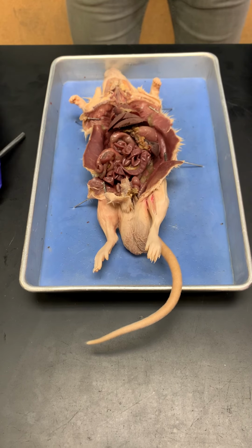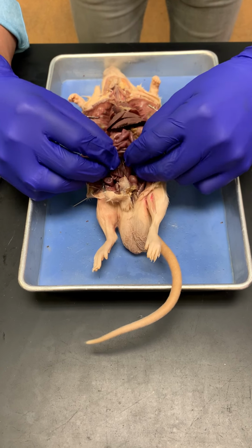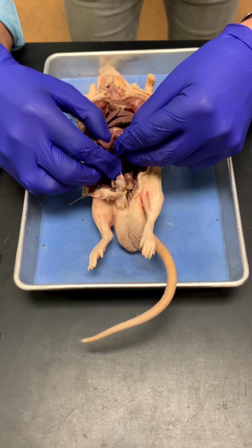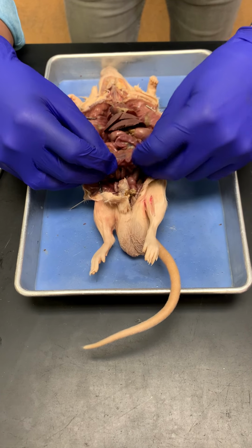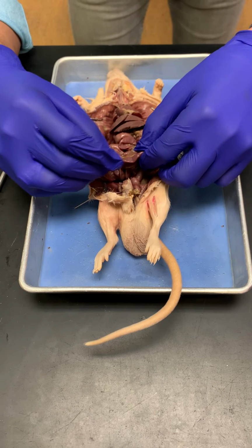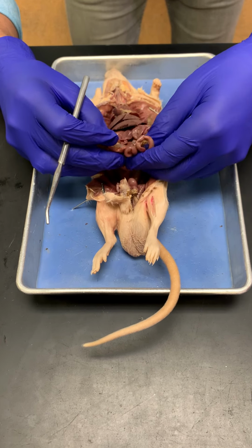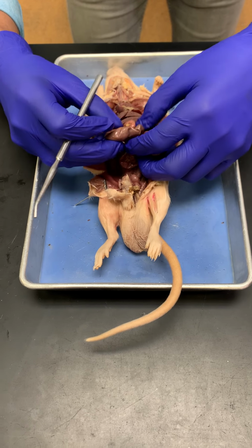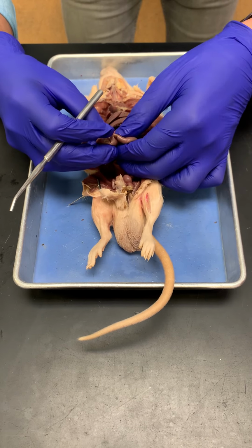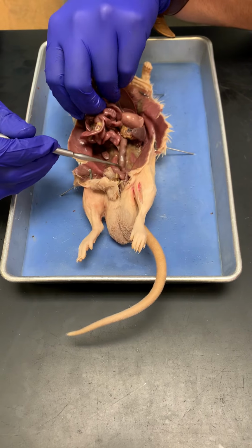And then the small intestines include all of this stuff. And all of this stuff right here, that keeps it all together, this is known as the mesentery. So this is all vasculature for the small intestines. And then once you get towards the end of the small intestines, you reach the initial part of the large intestine, which is known as the cecum. So this is the cecum right here.